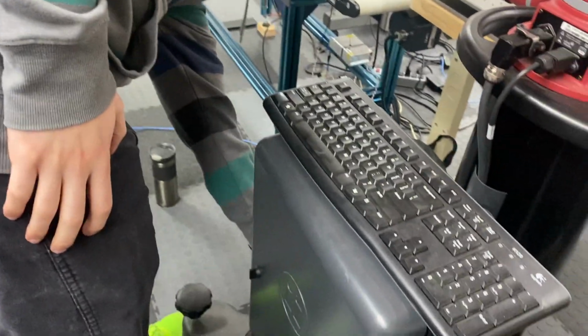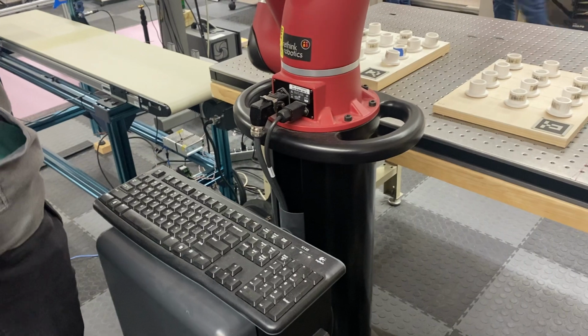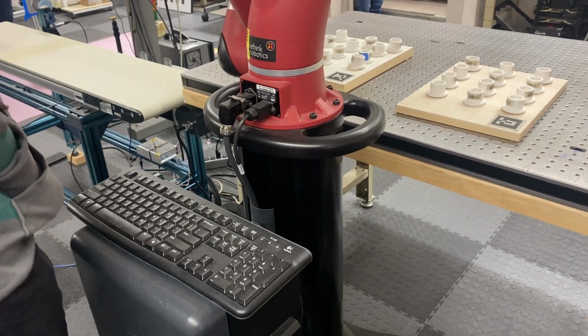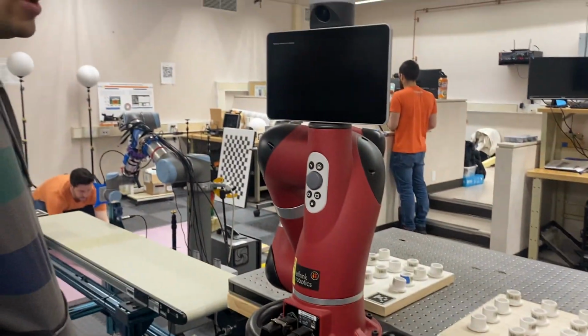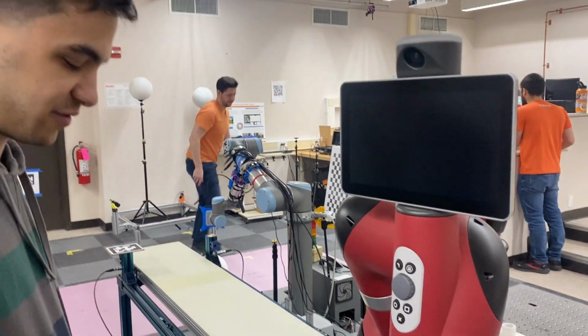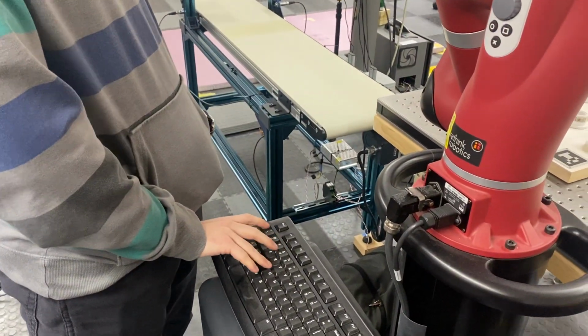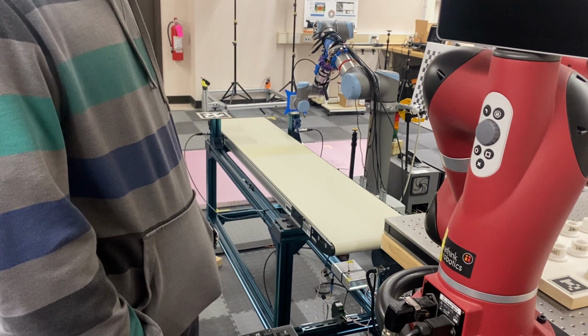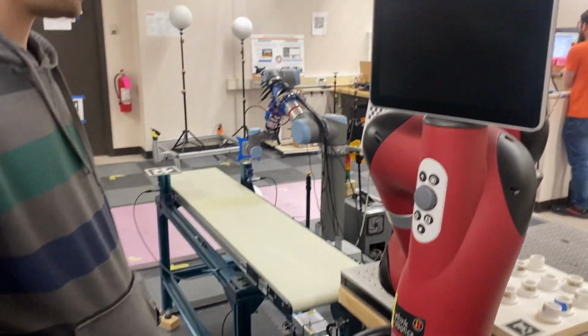Start turning it on again here. And in order to make sure it doesn't start again in the same mode as it did before, we are going to spam Control F on this keyboard. Very, very professional way of doing things.